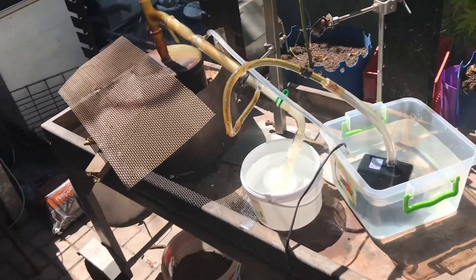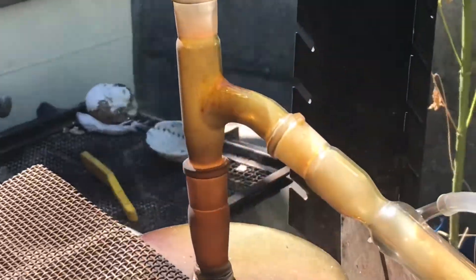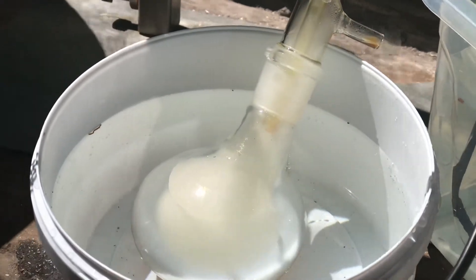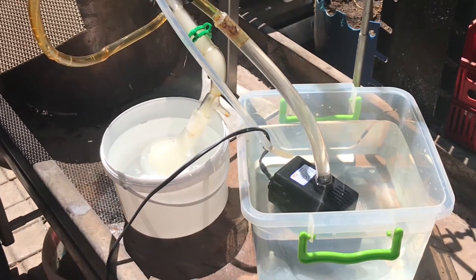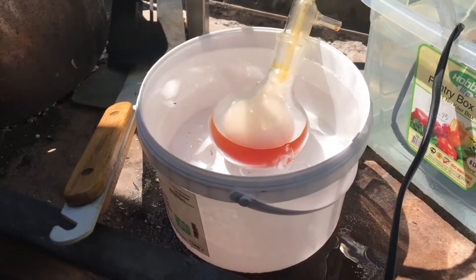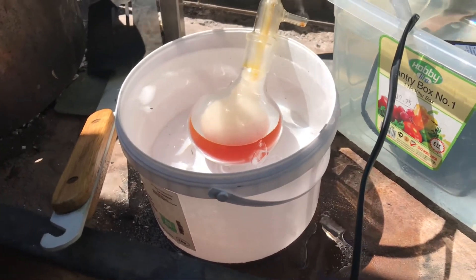I've moved the setup outside and it's going a lot better. I've put a metal grid so the flames don't reach the glassware — you can see all the smoke coming through. This time I'm actually getting drips and the benzene is not freezing in the column. We've got quite a lot of crude benzene now. My previous run only filled a small amount in the 500 mL flask, but this is nearly a full flask.